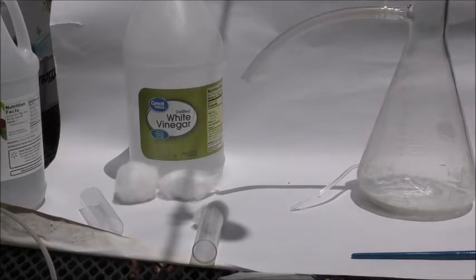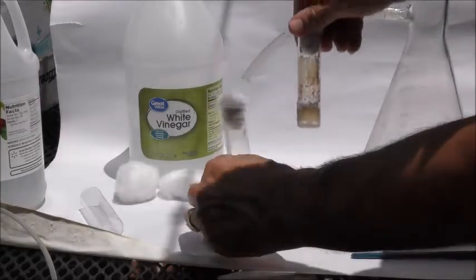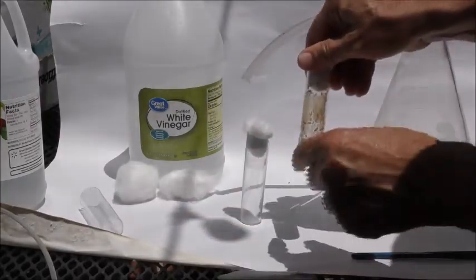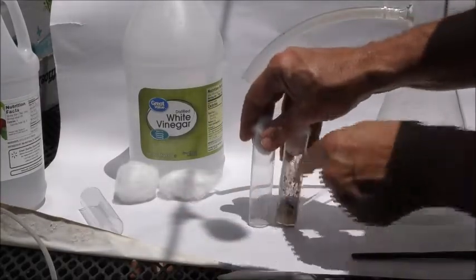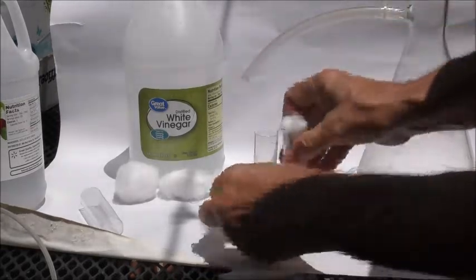If you want to anesthetize your flies, what you want to do is transfer them to a bottle without the food, and then you can get more flies out of there as well. So take the lids off.